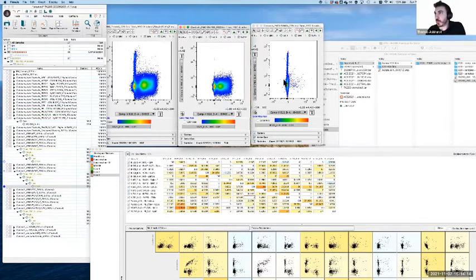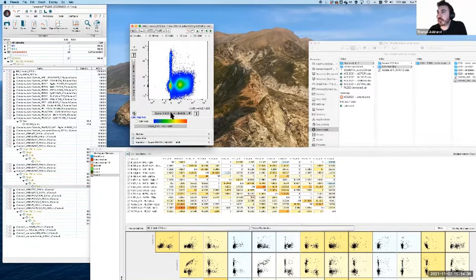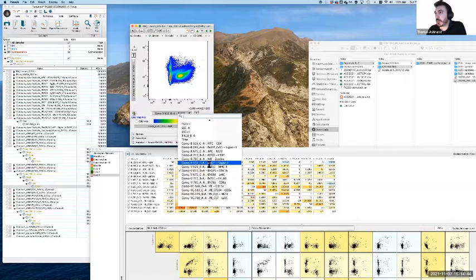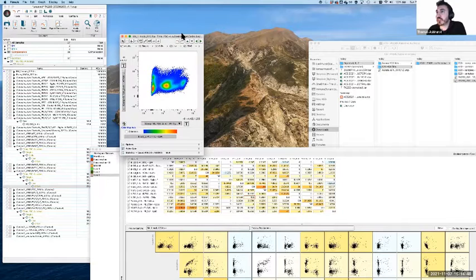But as you can see, by using both the FMO and the fully stained controls, we actually get a pretty good mapping of how this is supposed to change. Now, if you're doing this without FMOs, the real trick is that you don't 100% know if what you're doing is unreasonable or not. I have a brief example of this to make the point. There's a couple of combinations here which give some classic patterns, which we need to be able to deal with.